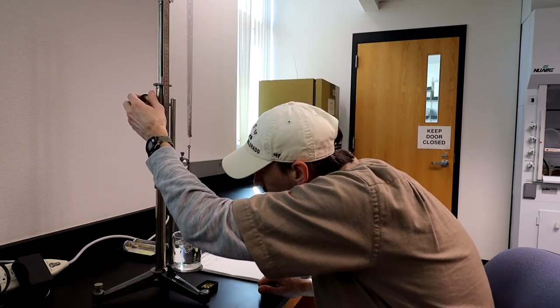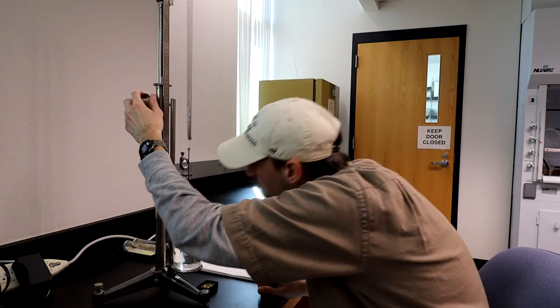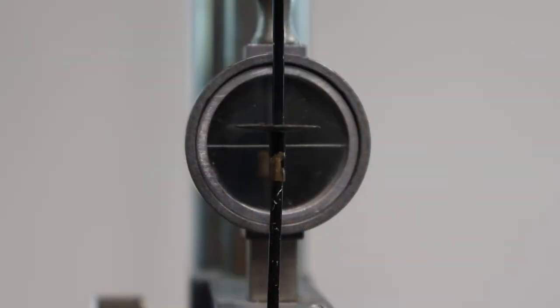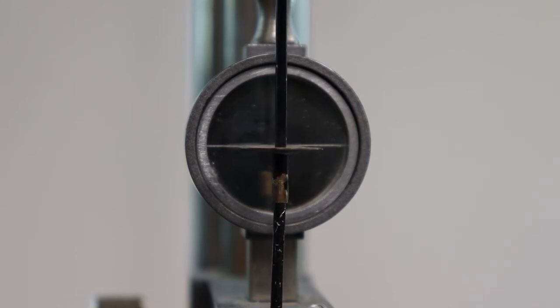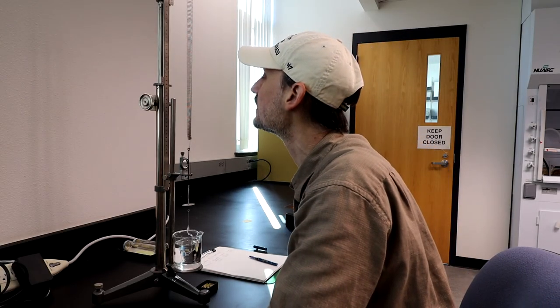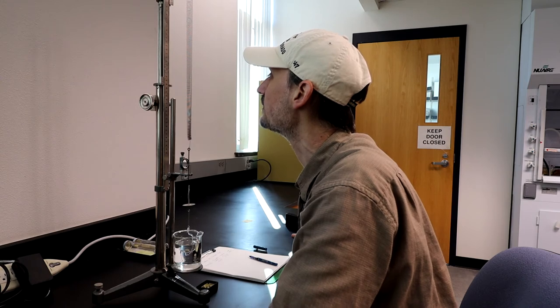Now you're going to lower the arm again, center it, and then read the measurement: 20.50.